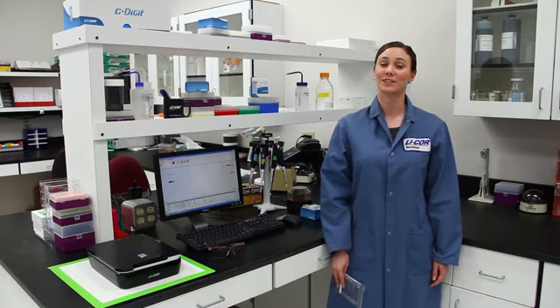Conveniently, the maximum scan size of the C-Digit is about the size of a mini gel, 8.5 x 10 cm. And before you turn on your C-Digit, be sure to install Image Studio software on your computer. A link to the Image Studio tutorial can be found on the same web page where you clicked to view this video.